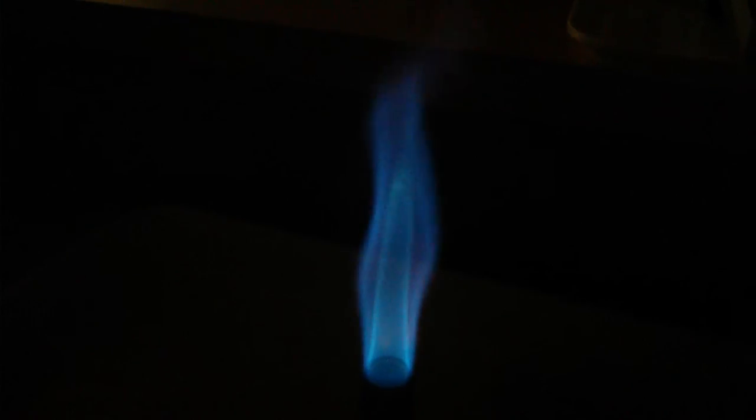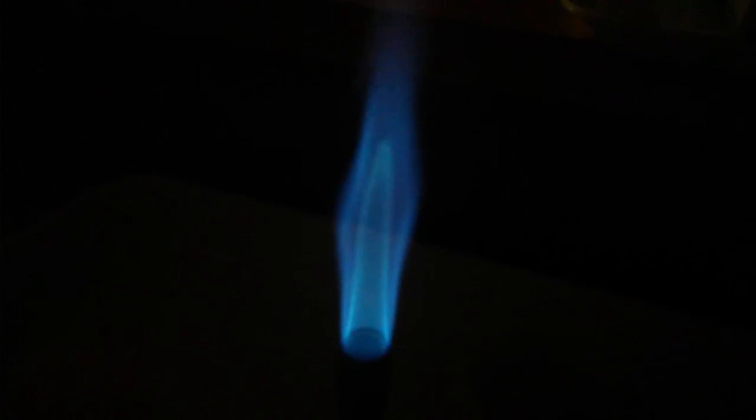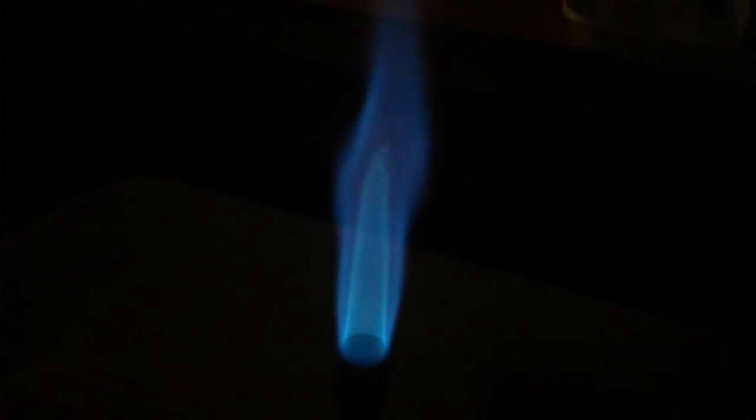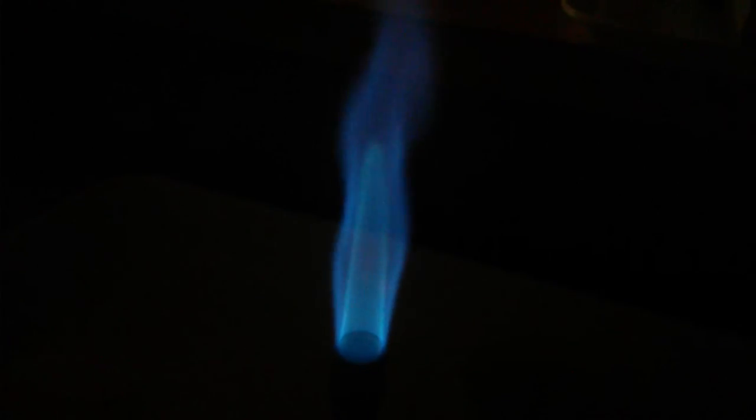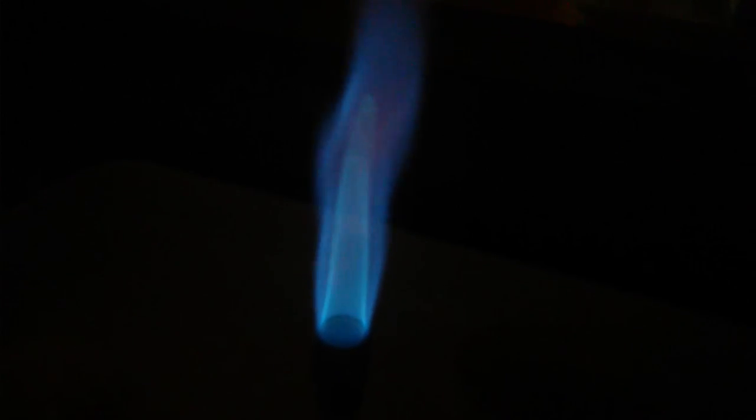So again for flaming and sterilizing quickly and efficiently you want the flame with lots of oxygen in it so it becomes blue. It has a little bit of a noise to it and it will present an internal bluer flame inside.